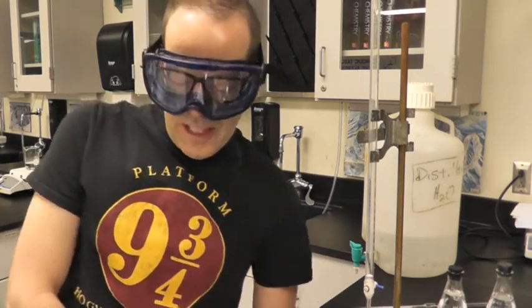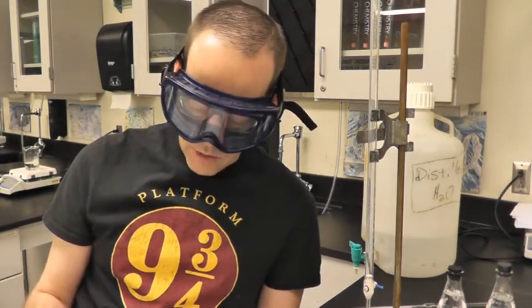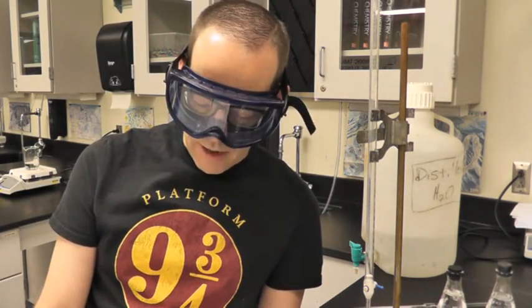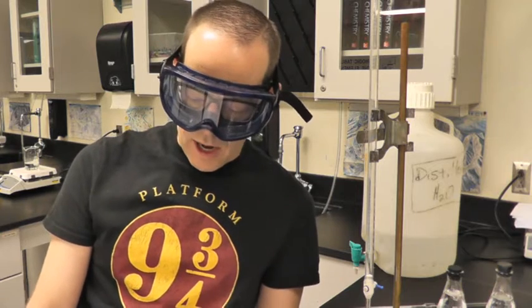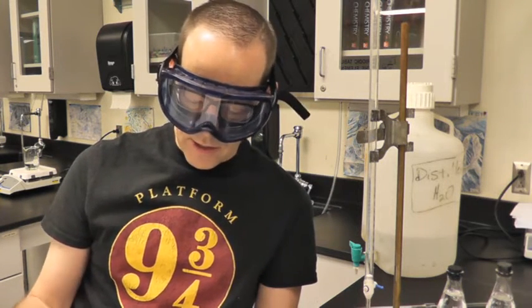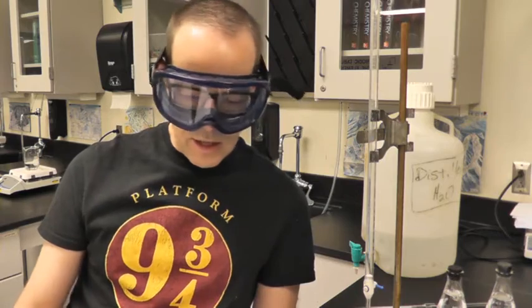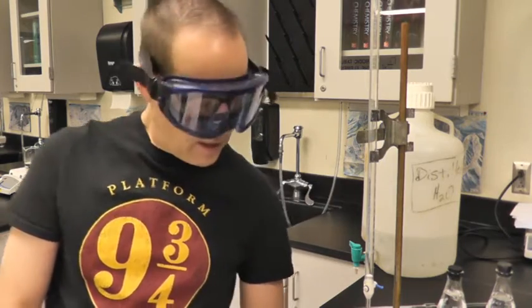All right, AP class, so today we are doing solubility product of calcium iodate. And it's right up there. It has the dissolution at the top. Calcium iodate solid is in equilibrium with calcium ions and 2 iodate ions. There's your KSP equation. And essentially it is a titration. So we are going to titrate with sodium thiosulfate.